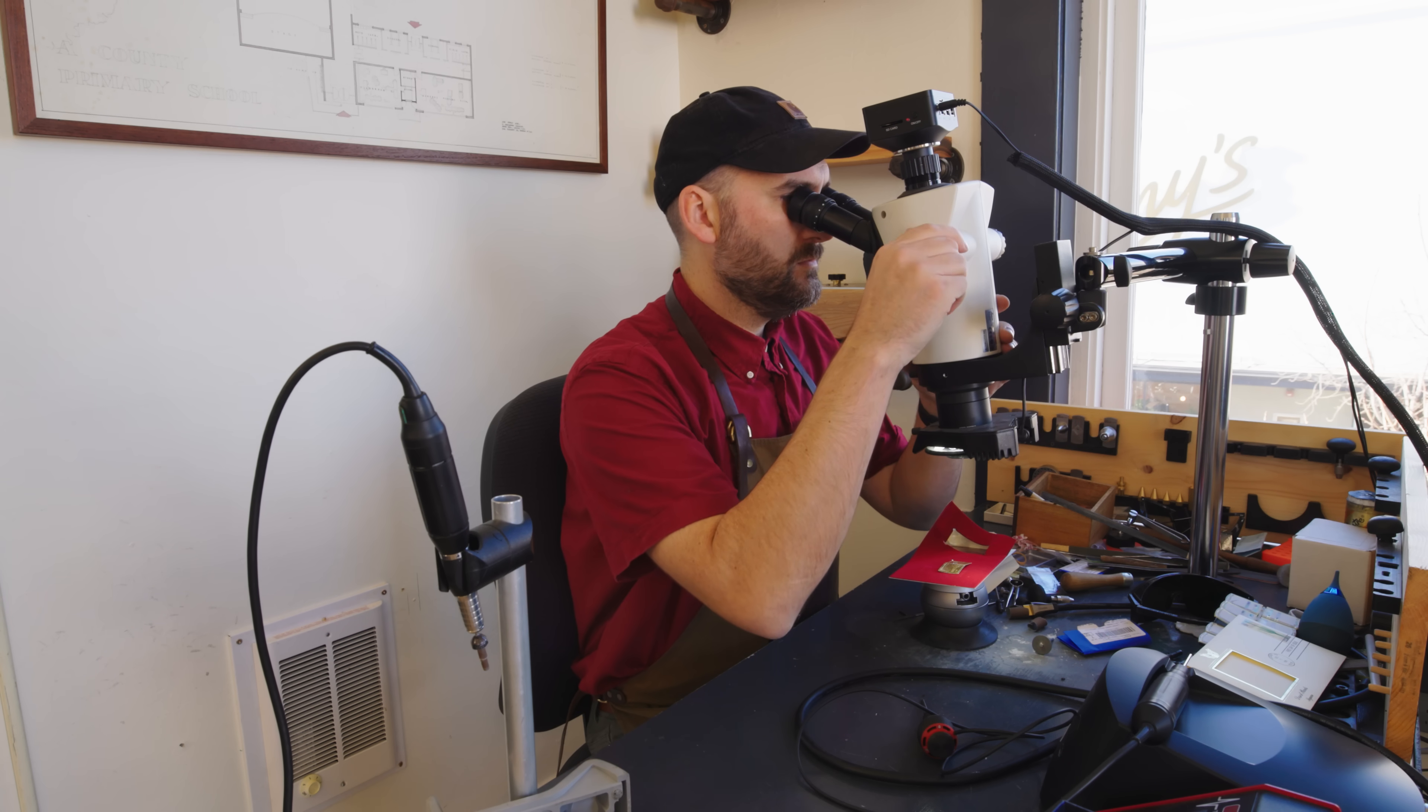So I went over to my microscope and took a look at the stamp under that magnification. Wow. That really is insanely thin.